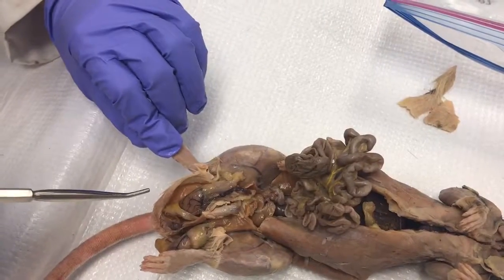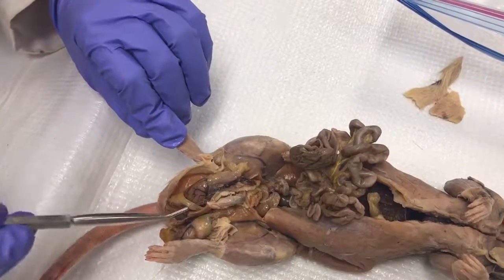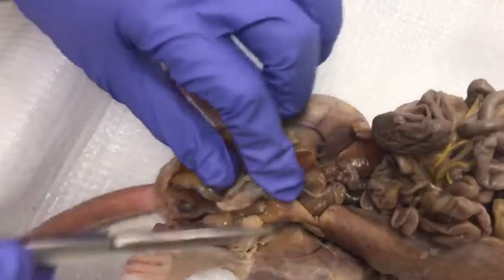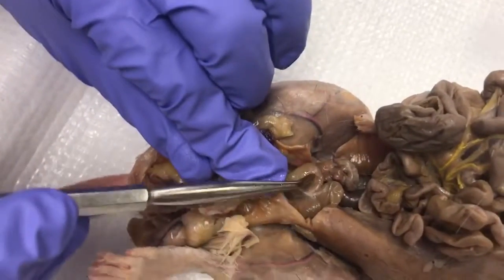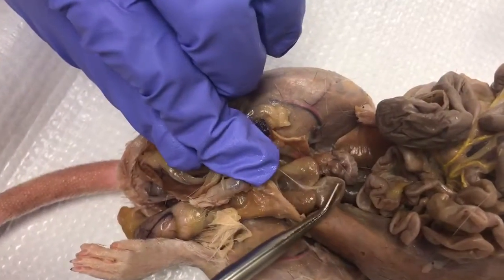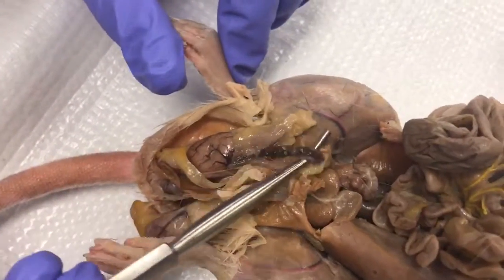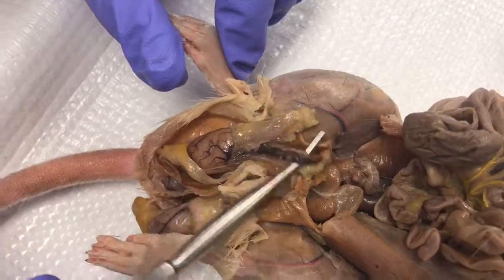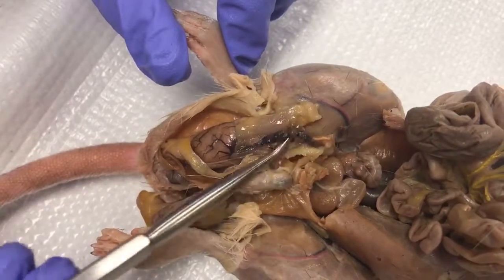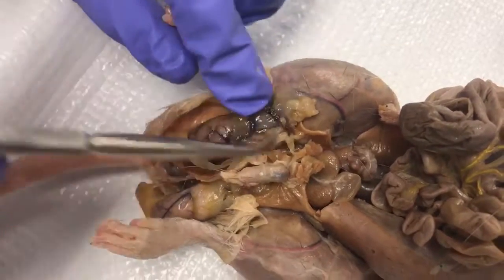Here we're looking at the ventral view of a male rat. Right here we have the two bulbourethral glands. Here is the urinary bladder. Here is the testicular ligament, this darker region.